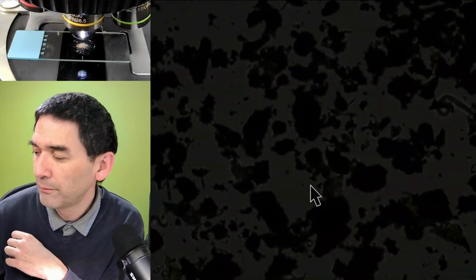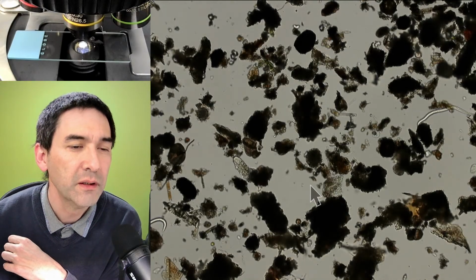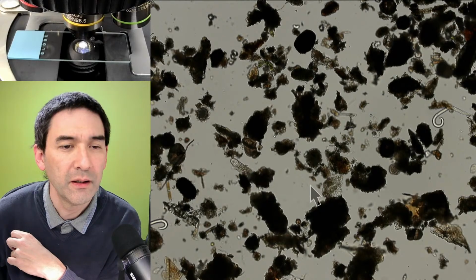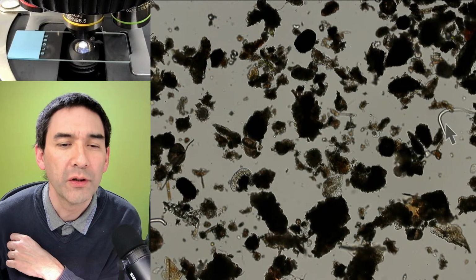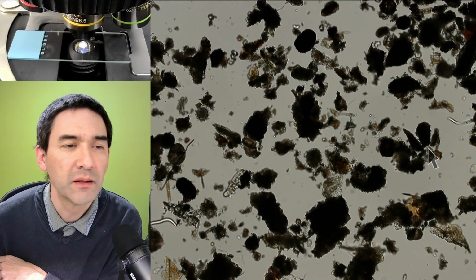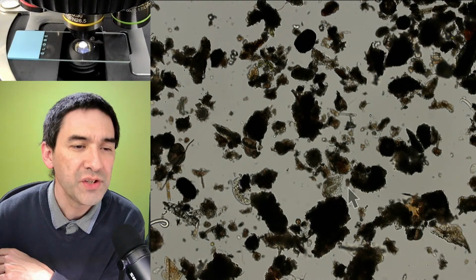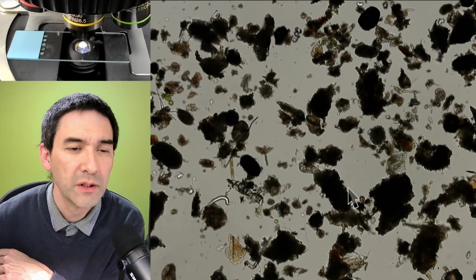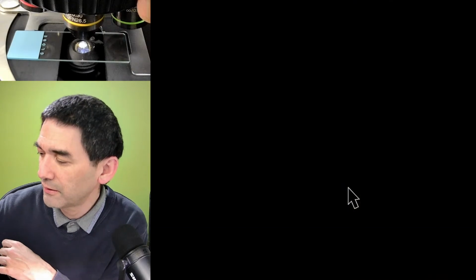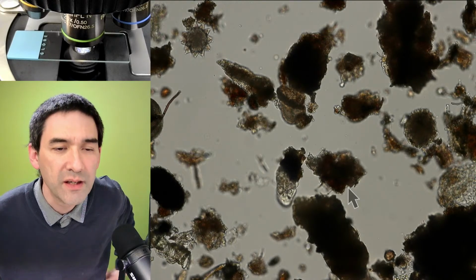Right. Let's go up with the magnification. I flip in the condenser. And yep, here it is. Okay, here we already have the next moss piglet, the next water bear, a nematode worm over here, some single-celled microorganisms over here. Another nematode worm. Look, you see that a moss piglet is very active. So you see that actually we were quite fast in finding them. Here it is again.